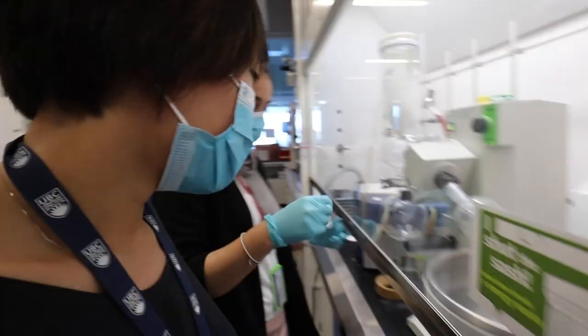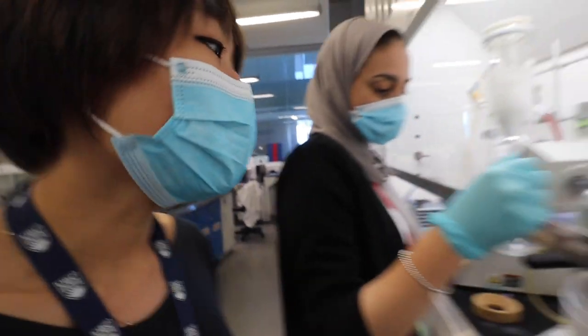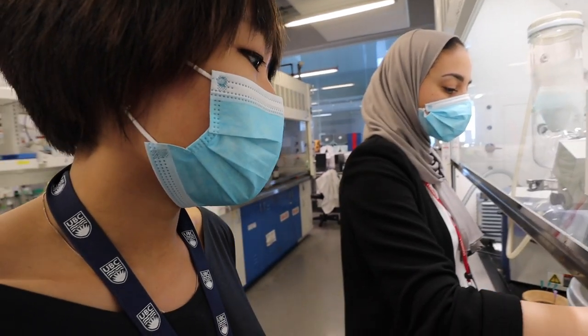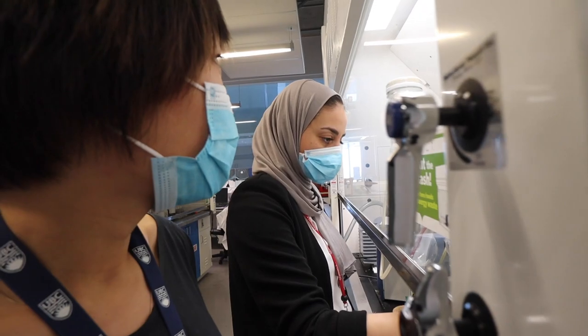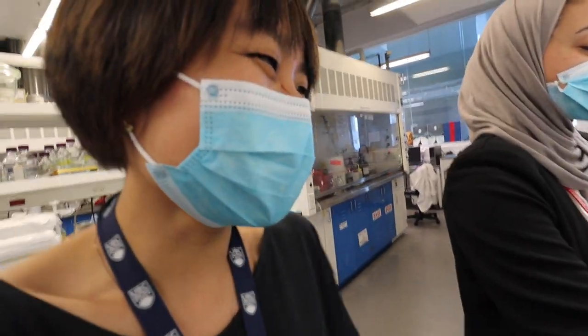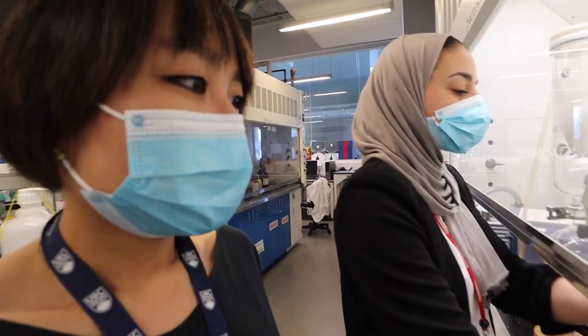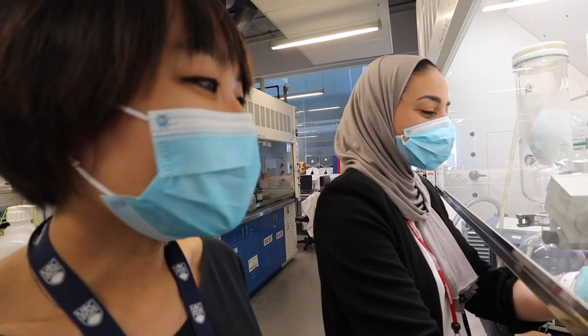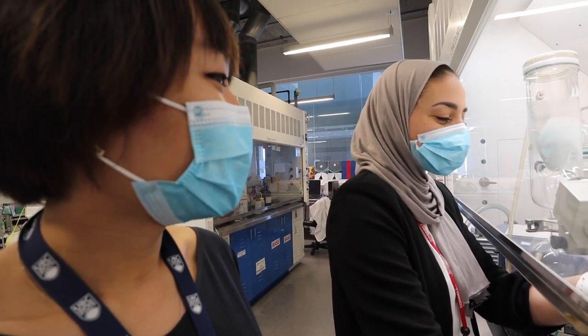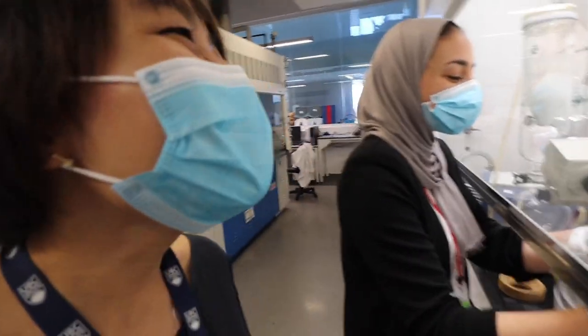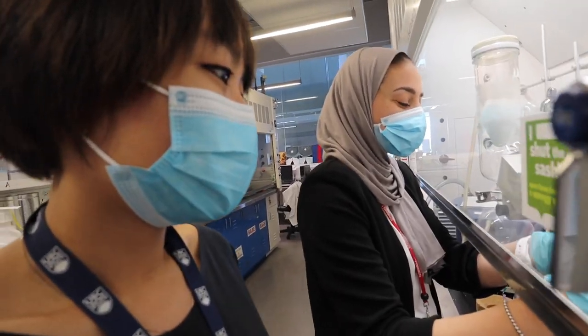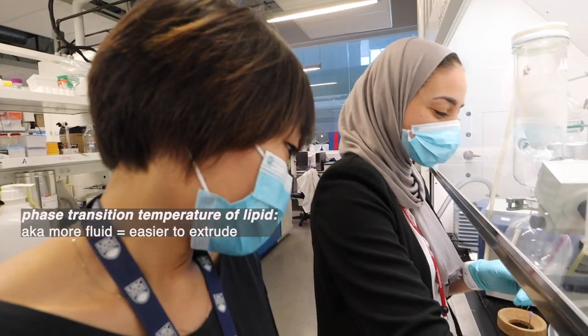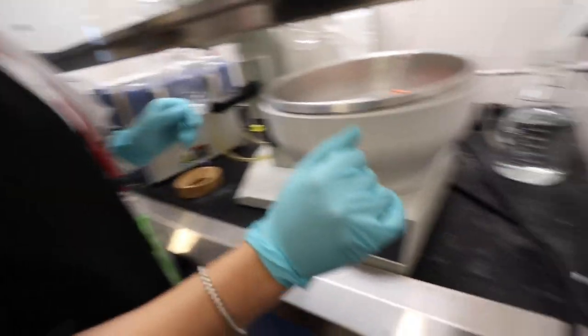First, we heat it. Heat the mixture. So it is 60... Why? Why do we heat it? To get all the thin film, all the thin film. 60 degrees is the temperature that the lipid is flexible? Okay, I guessed. So that's the glass transition temperature, TG. Is it? Something for the lipid. Wait, that's a polymer. TG is for polymer. Transition temperature. Yeah, that. So I think it's around 60 for the SPC.